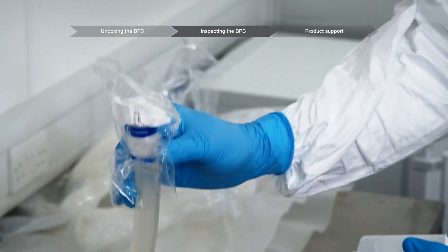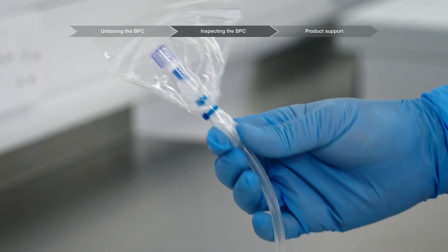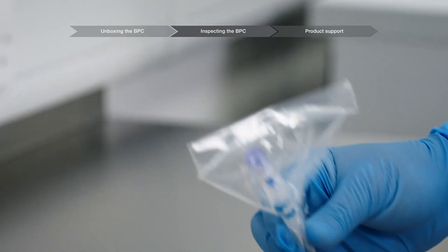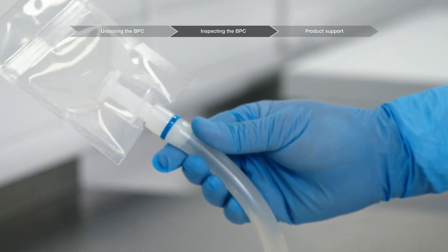Connector inspection should also include the inspection of aseptic, steam through, and steam to connectors to ensure that they are in the correct position and have not been actuated.